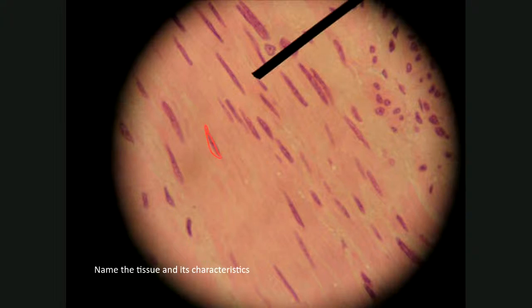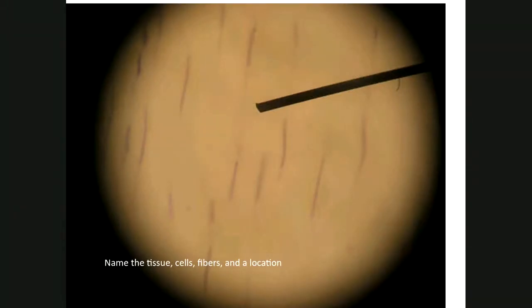They don't necessarily look like lines, they look like ovals. Go back to this tissue here. These are lines, they look like lines because they're completely hidden. They're so hidden that all you see is a little line. These are nuclei of cells, of the fibroblasts, completely hidden by the collagen fibers that are running in one direction all over the place.